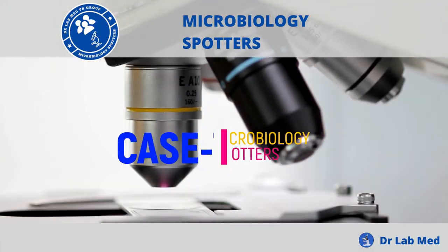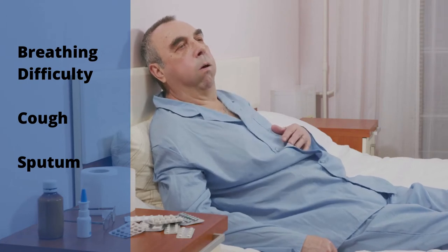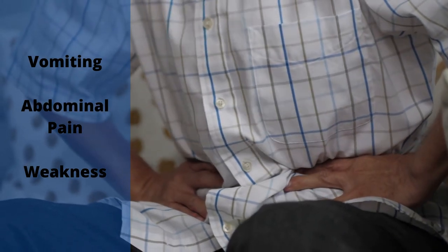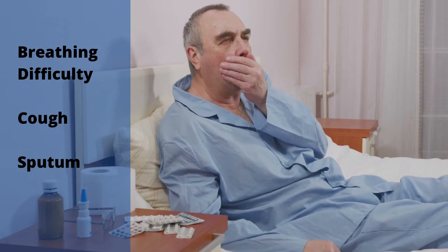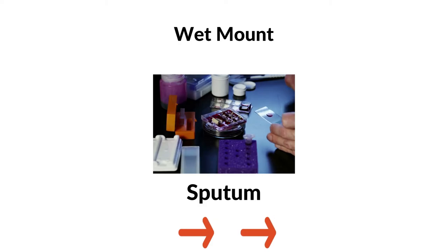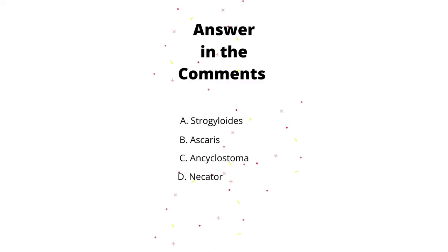Let's start with the next case. A 79-year-old man came to medical emergency with breathing difficulty, cough with sputum, along with vomiting, abdominal pain, and weakness since one week. The previous report suggests that he is HIV positive and was suffering from Pneumocystis pneumonia. Wet mount of sputum reveals this picture — identify the organism. These were the options.